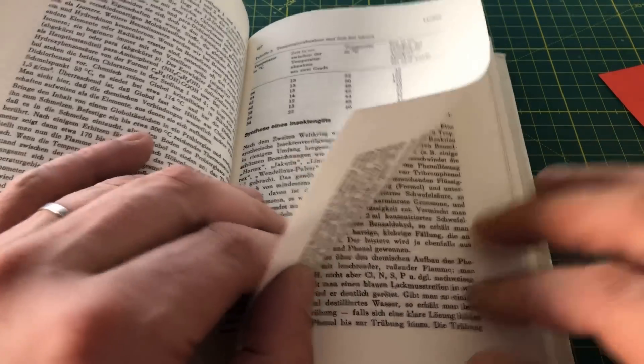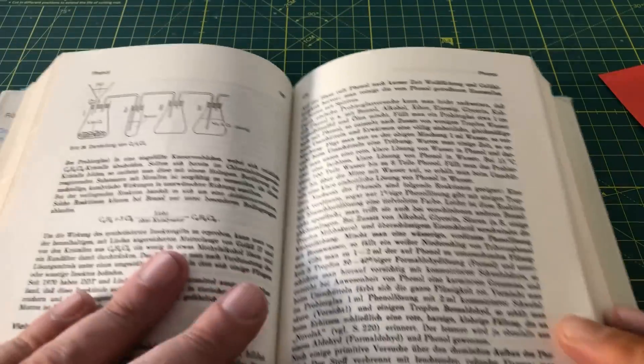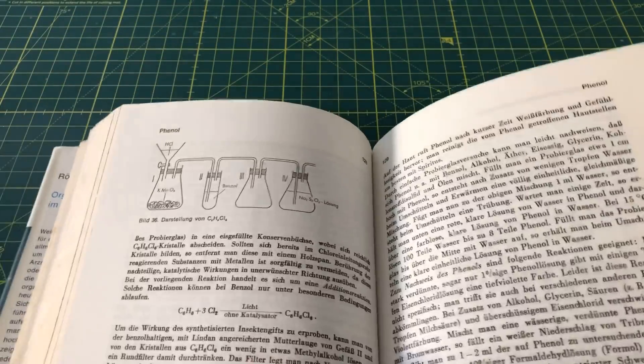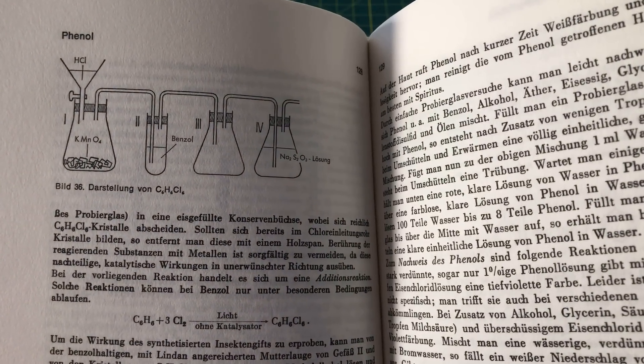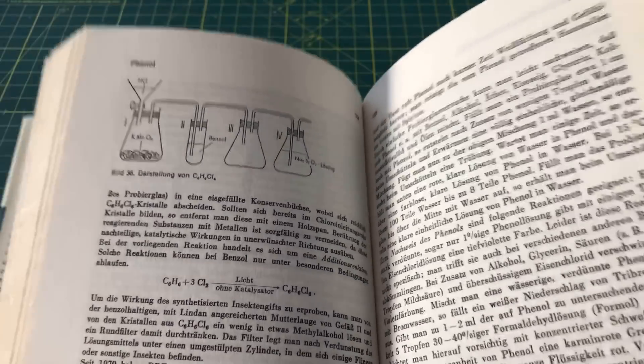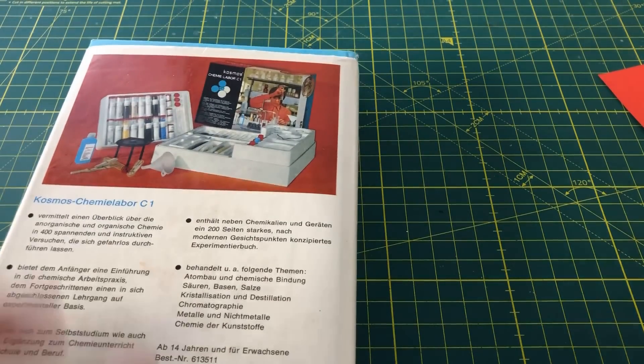For the synthesis of lindane, benzene is required. Benzene is a toxic substance that can cause both acute and chronic health damage and is carcinogenic. Because the substance is for this reason difficult to purchase, I will synthesize the benzene in this first part.